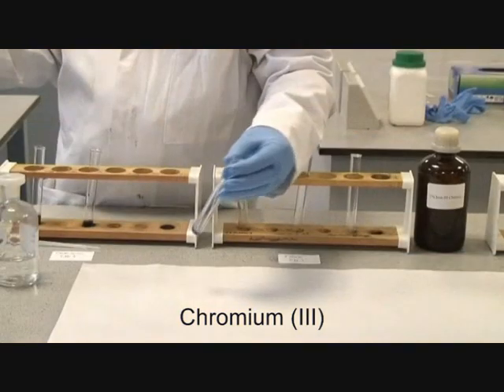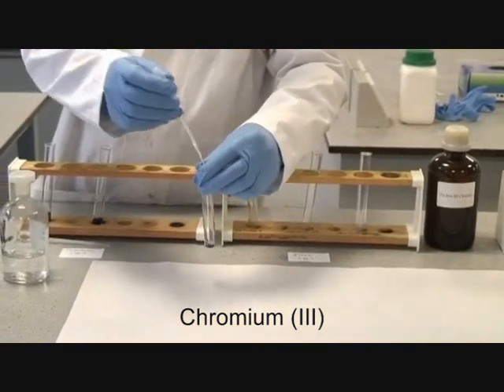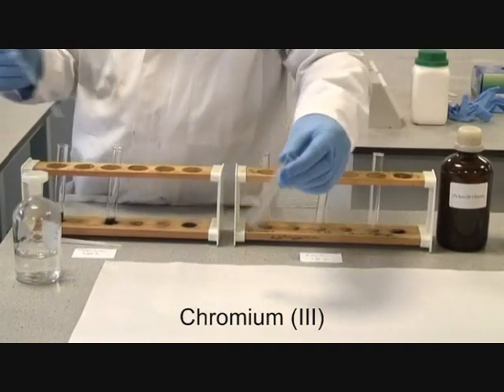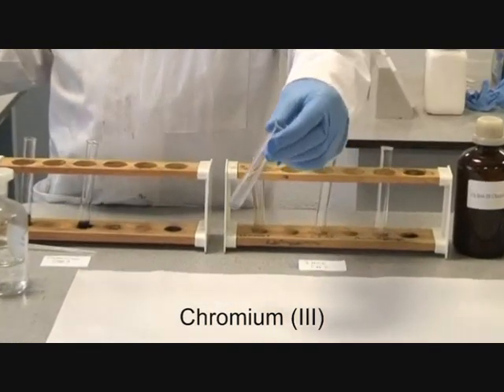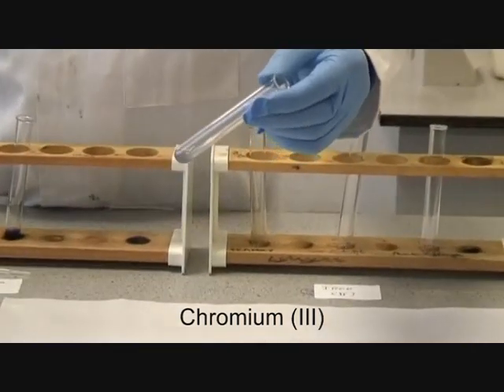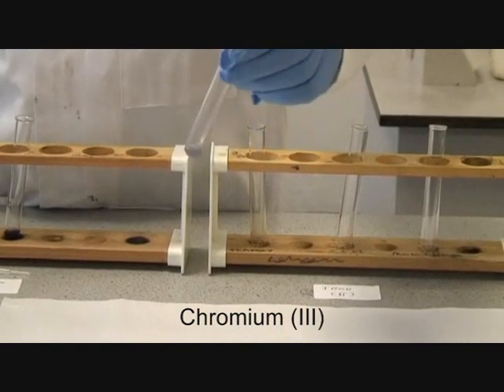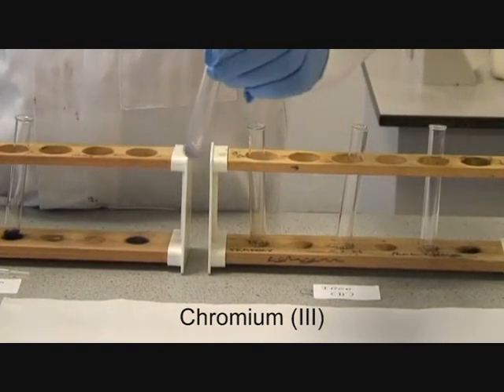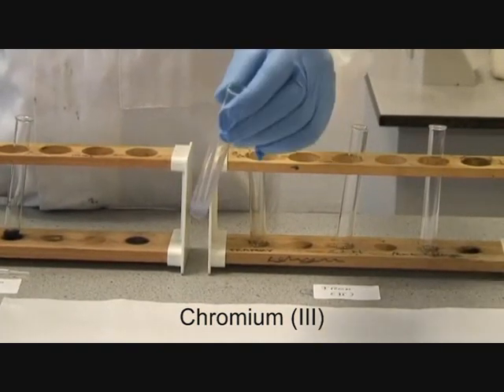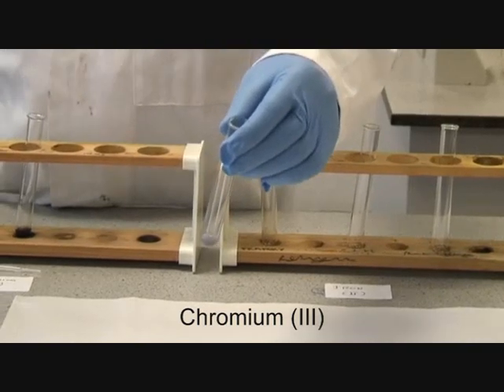We're now going to add ammonia solution to a solution of chromium 3 and again note the effect of it. You do get a greeny precipitate, which is almost instantaneously starting to re-dissolve in the ammonia.